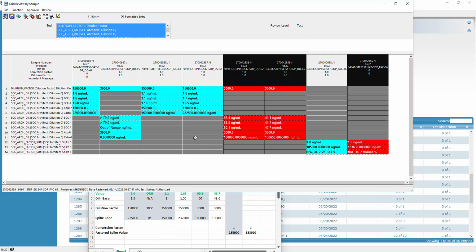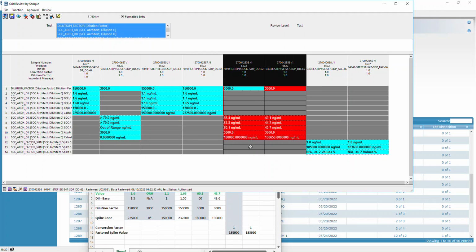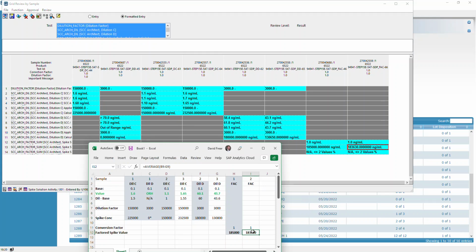And so what happened at this point is this factor summary doesn't only include these 2 samples. This factor summary is looking across all the samples on the product itself that match the dilution for this particular test. And so what happens is this dilution here, or this summary, will look across all the dilutions and average them all together. Of course, not using the 0. And so that's why we get a value of 183,660.